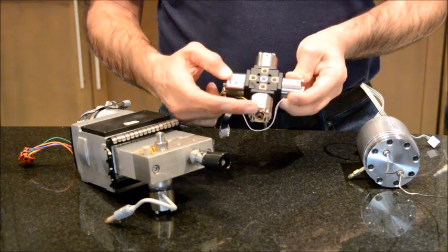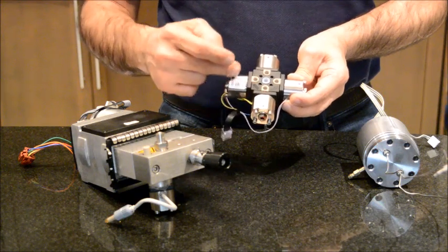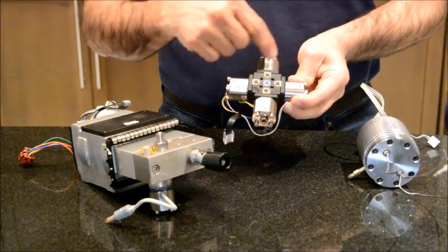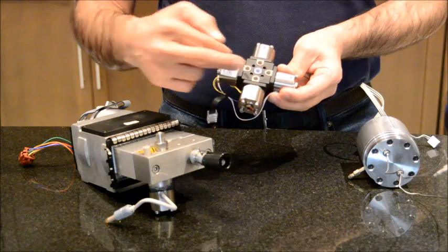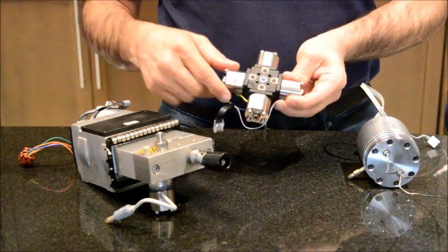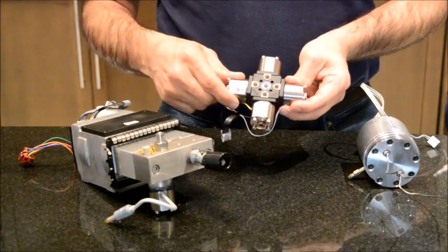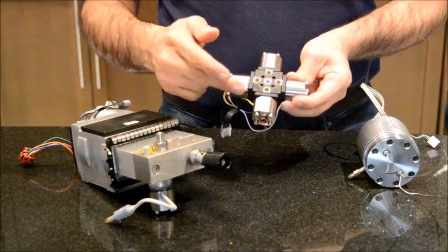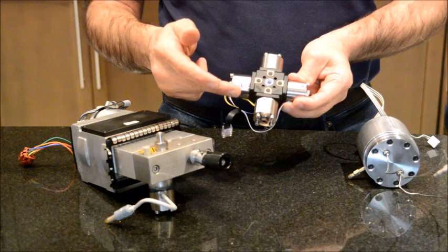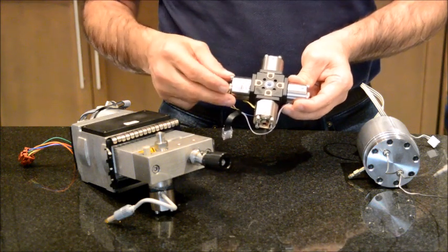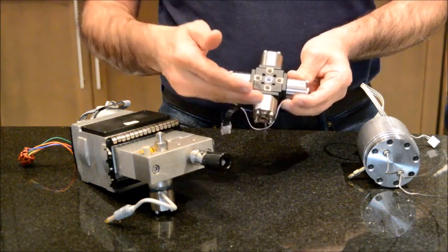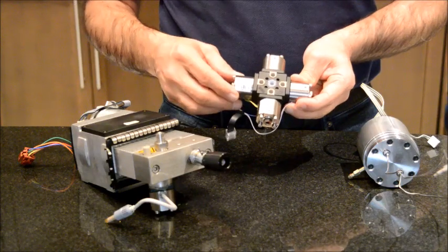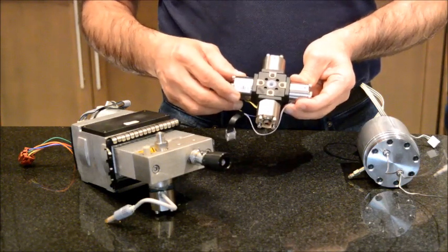The solenoid valve will open halfway through in A and B and will shut, closing C and D, and it will draw in half A, half B into the mixing chamber. Now if this unit doesn't work properly, what will happen is that probably you will not get the composition that you are expecting. Instead of 50 A, 50 B, you will get some other composition, and what you would notice in your chromatography is that the peaks will not appear where you expect them to appear.